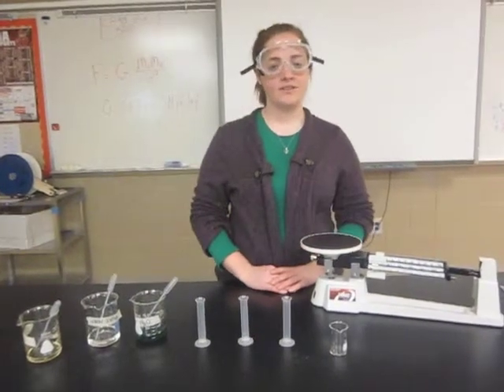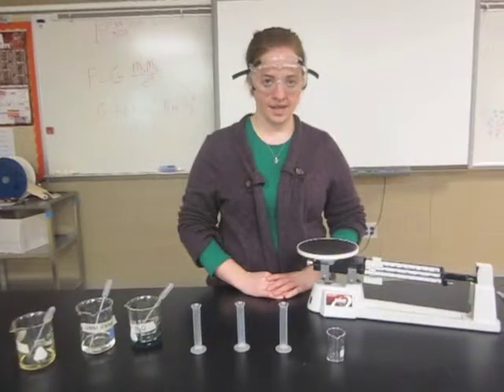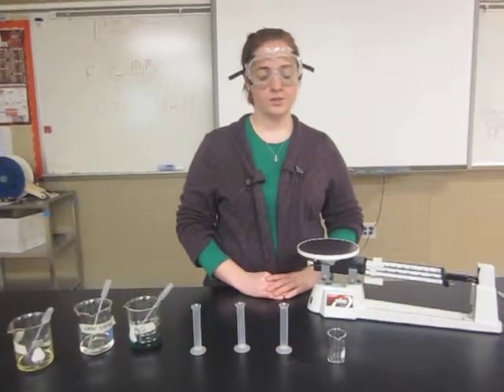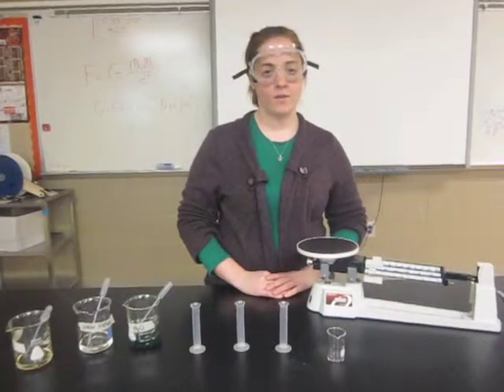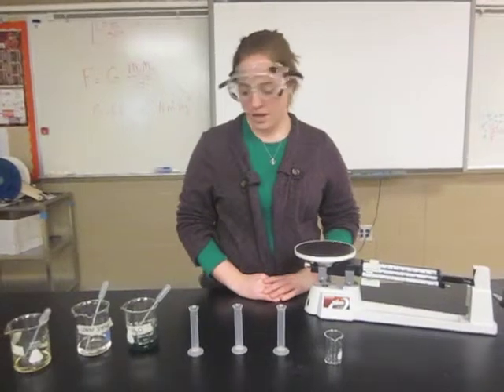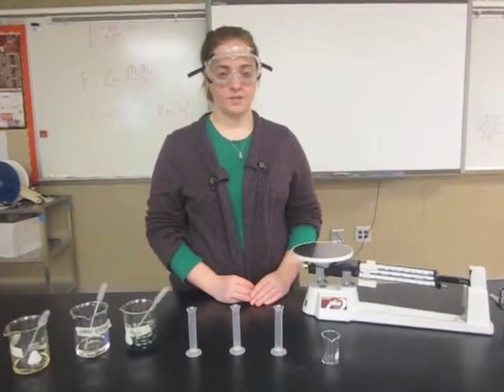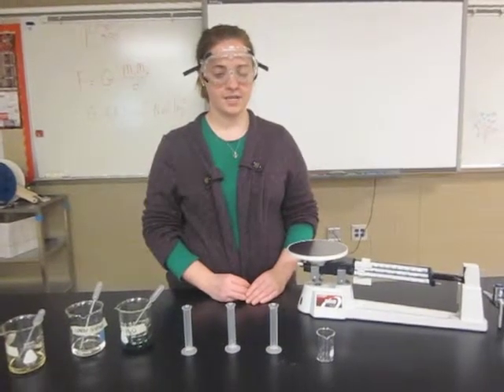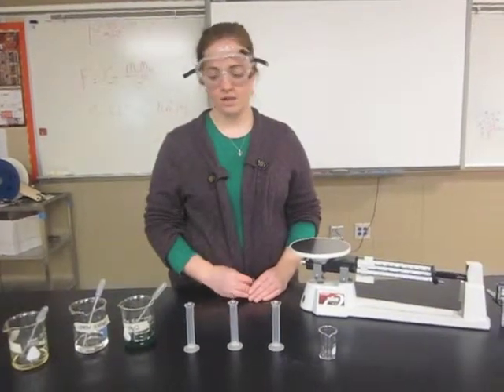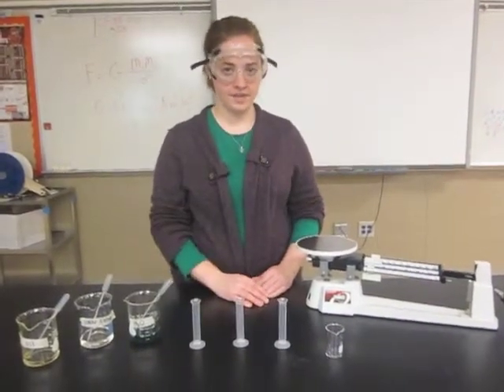In this lab you're going to investigate the density of three different liquids and create a density column. Before you begin, you want to set up a chart to record all of your data in. You want to have four columns going down and three rows going across. Your first column will have labels for mass, volume, and density, and going across should have your substances: oil, corn syrup, and water. Your chart should look something like this.